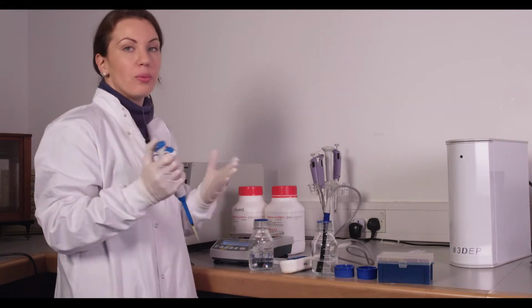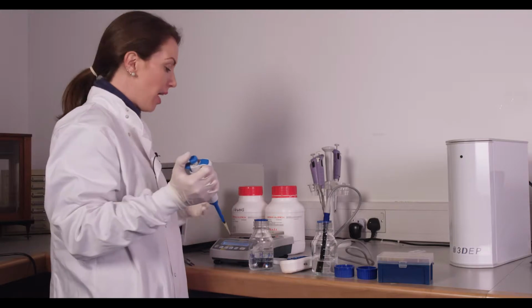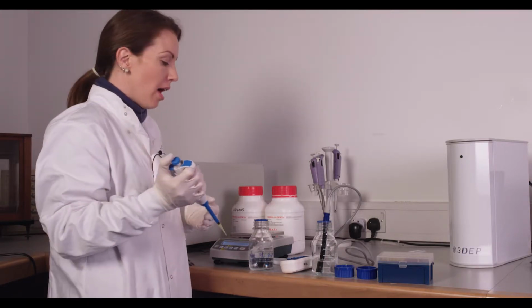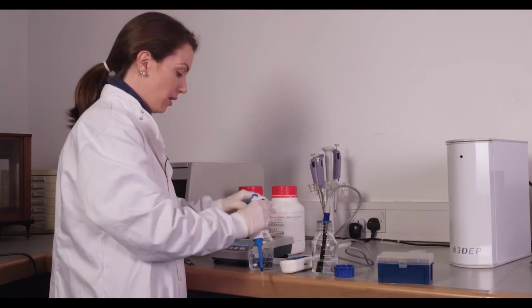The amount that you add will vary from day to day. It depends on whatever the room temperature is. It depends on how accurately you measured your sugars. So don't be concerned if you don't get the exact same number every time or you're not adding the exact same amount of PBS every time. Just go for the conductivity that you need.